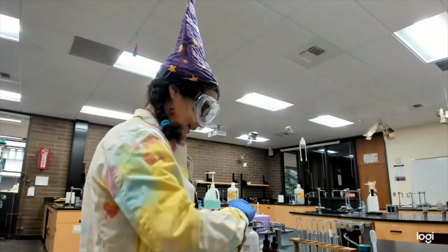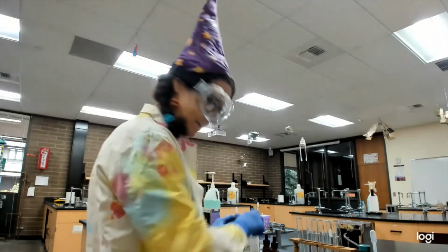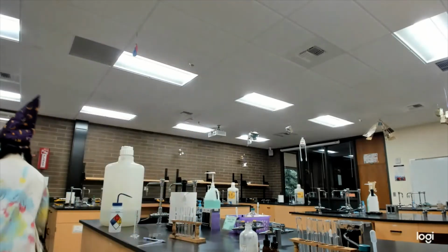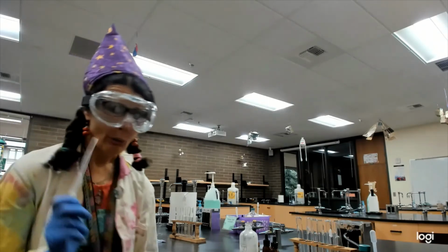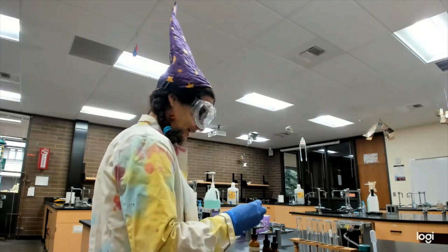Sugar and spice and everything. Maybe you remember. Oh, we're not going to have enough test tubes. What am I supposed to do? Now we're going to add 20 drops of Lucas. Now, one of them reacts immediately. Does anybody remember? We're going to know.